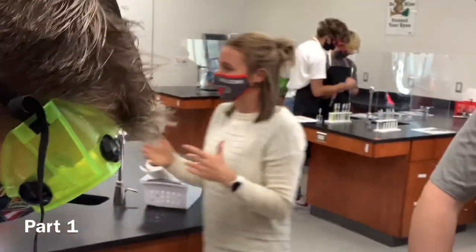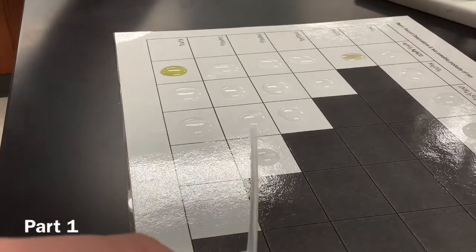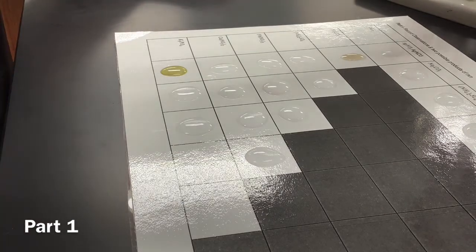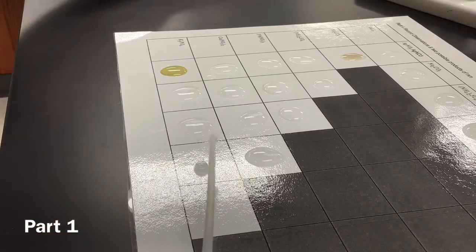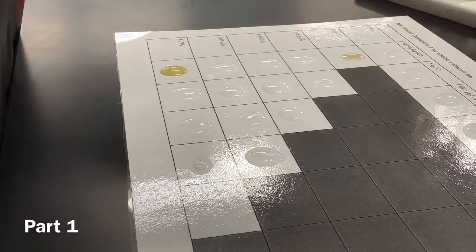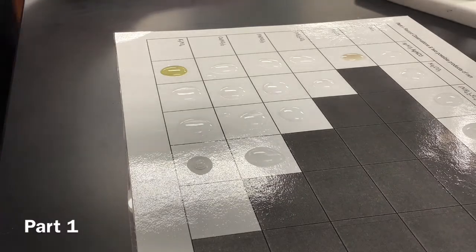So I would do all of your drawings, and then you can come back and calcium nitrate, everyone. This stuff is cool because it has calcium in it and also nitrate. Wow, what an insight. But you know what? It's not cool today. No, 'cause it's lame. Nothing happened. It did nothing. You know, we try to make it interesting for us viewers at home, but we can't control science. Science controls us. Yes. We should do a PSA on how science controls everyone.